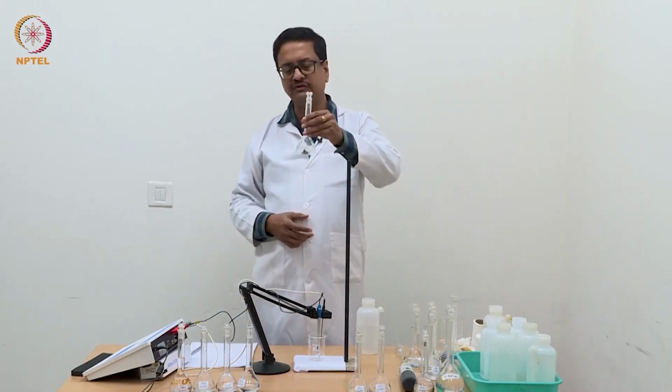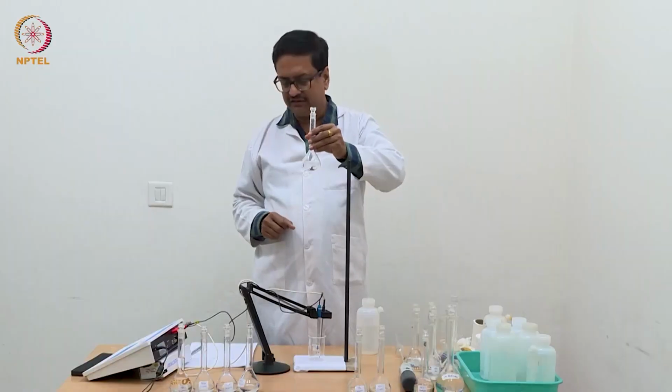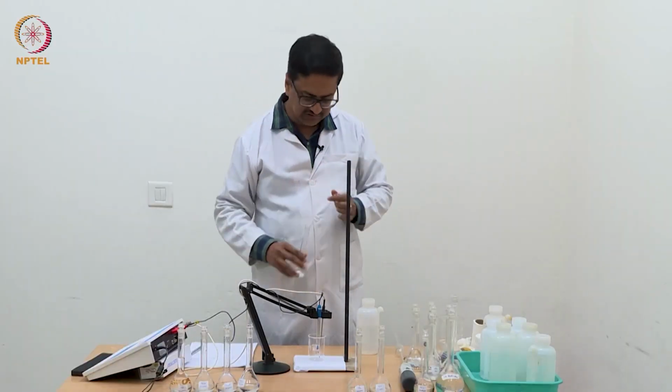So now I am going to use this N/4 acetic acid for my 7th reading, and then we will end with N/2 acetic acid.